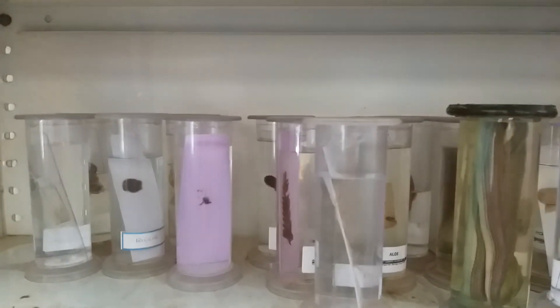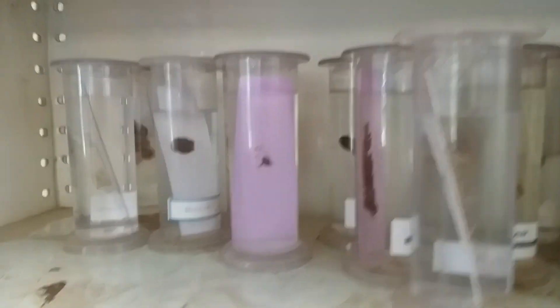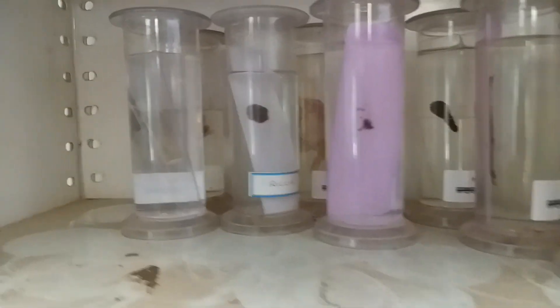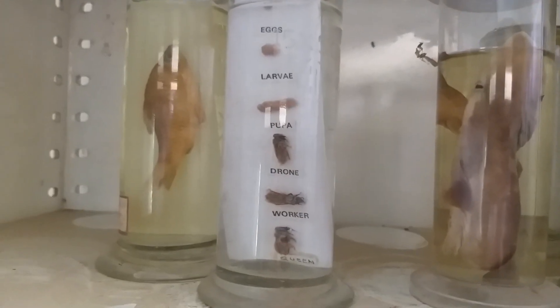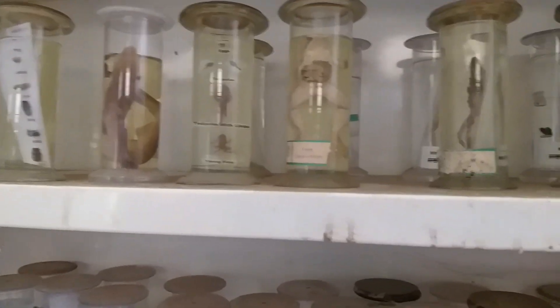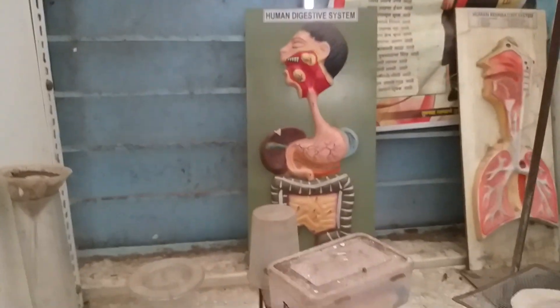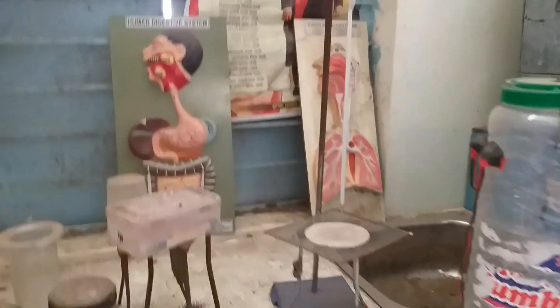These are specimens including starfish, sponge, rohu fish, frog, and some plants like fern, riccia, and funaria. There are also some stages of metamorphosis in honeybees and frogs, along with other samples.